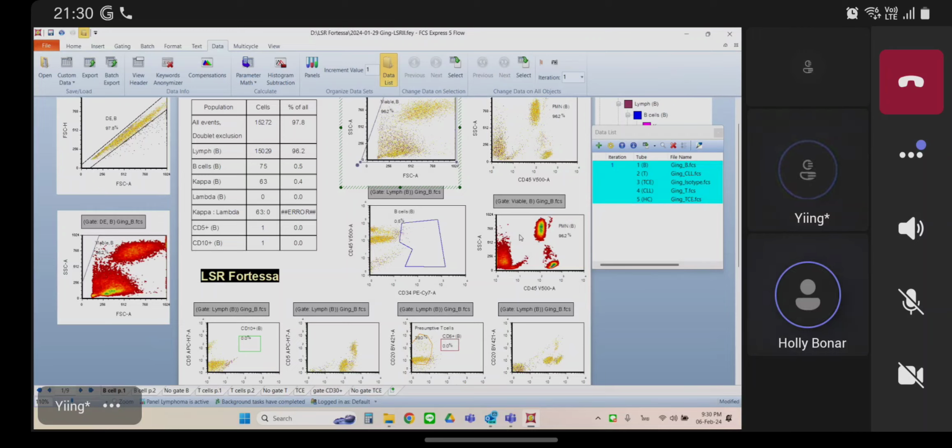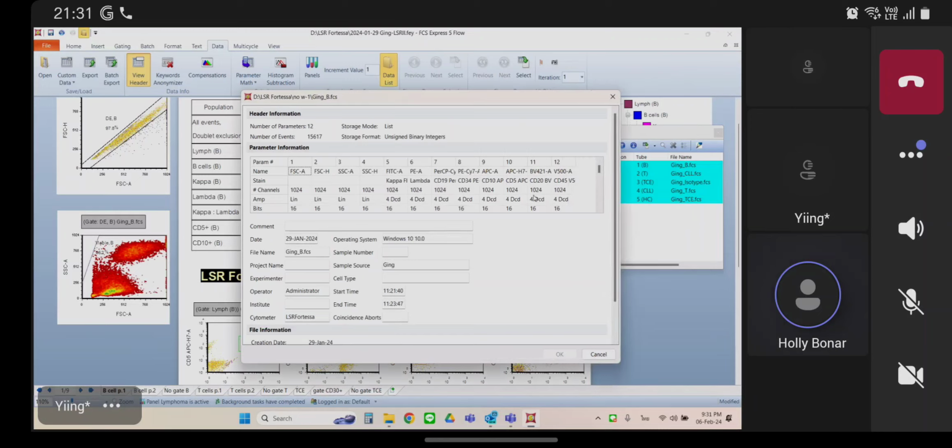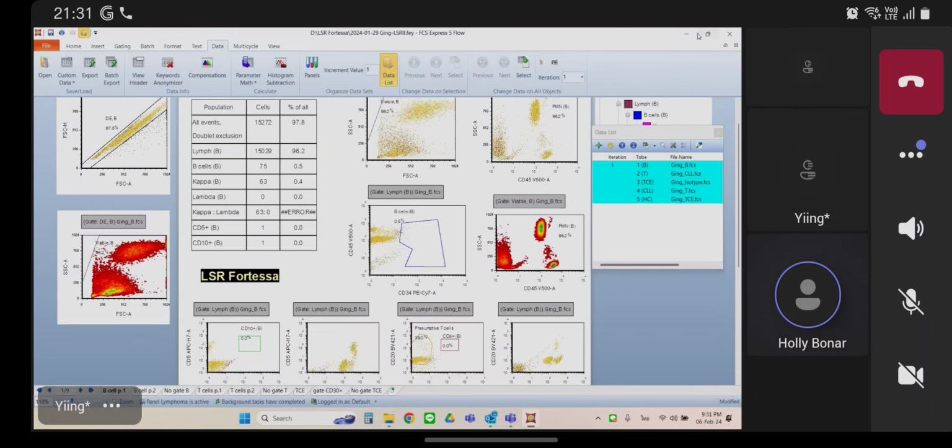The template. So this template doesn't work either. If you look down at your fluorochromes, they're all wrong too. And it's because on this data set, you only have 4 scatter parameters. So it's like you're using different data sets, and the template can only accommodate one data set with a certain number of parameters. So you're not going to be able to use this layout to look at your old data sets that have different numbers of parameters. The only thing really that you can do is to start exporting your data consistently from the instrument so that you're always exporting the same parameters every single time.